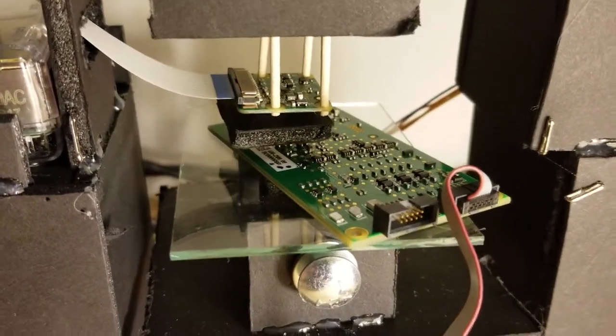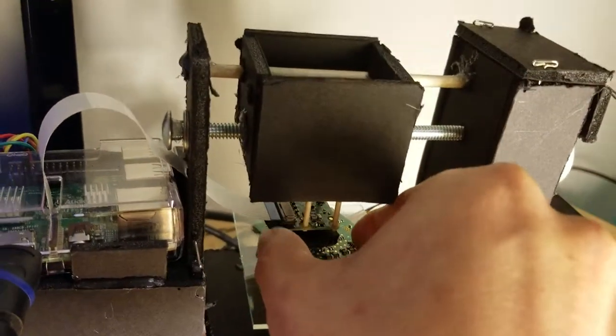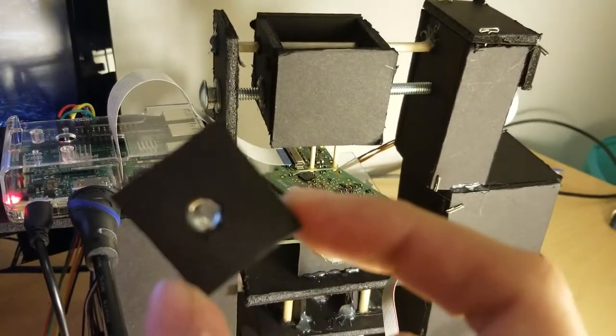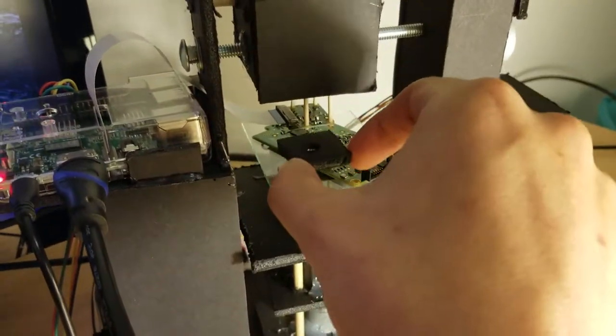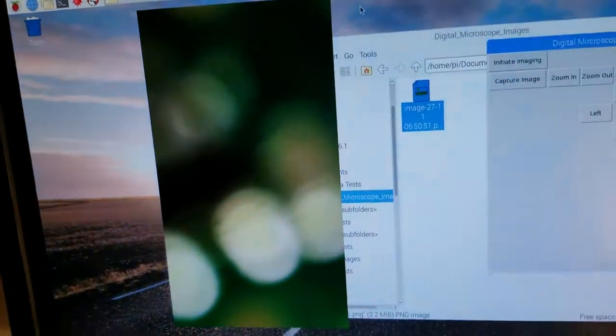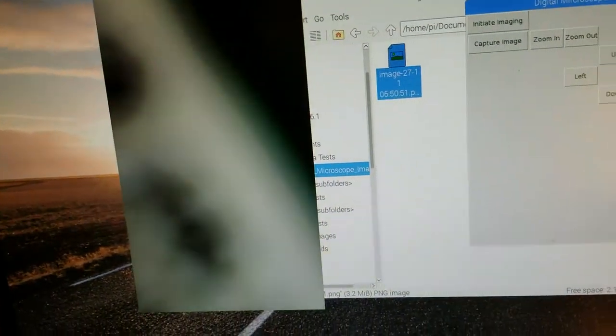In order to get magnification, I have a Raspberry camera here. This is an 8-megapixel camera, and what I've done to magnify everything is, let me pull this out, I have a lens taken off of a laser pointer embedded here, and this simply attaches onto the camera itself and magnifies everything. Without the lens, we see that everything is incredibly blurry and we can no longer get magnification.